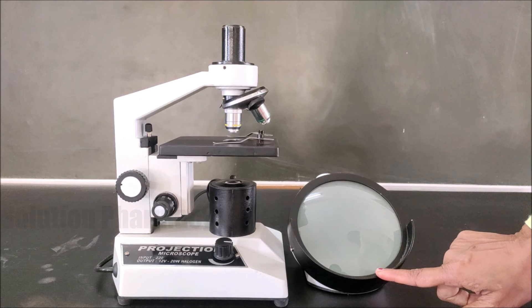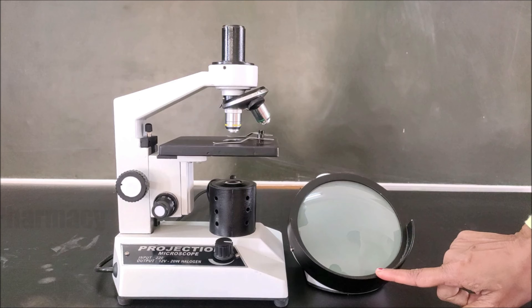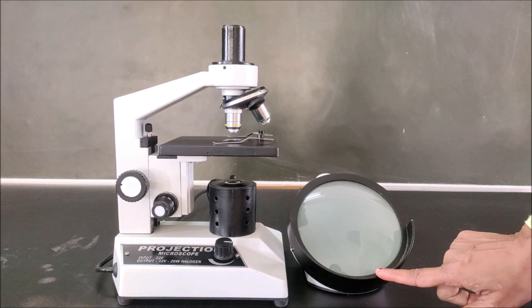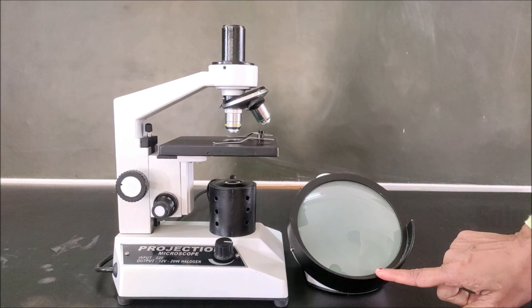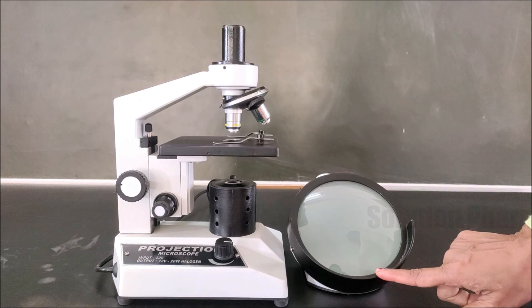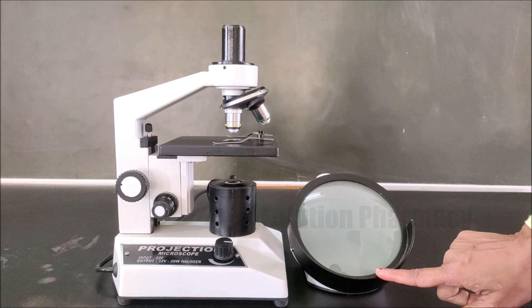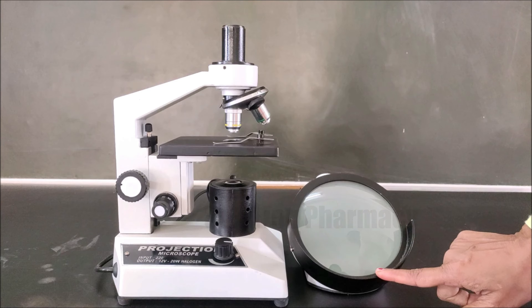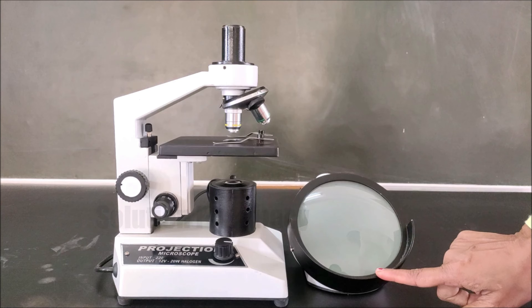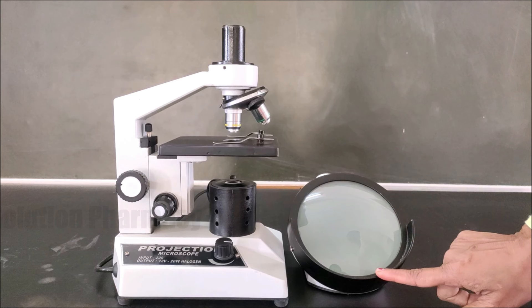Normally in a compound light microscope we observe the magnified image of the specimen through the eyepiece. But in the projection microscope there is no need to look through an eyepiece, because the magnified image of the microscopic object is projected on the screen, from where we directly observe the image due to the projecting lens.